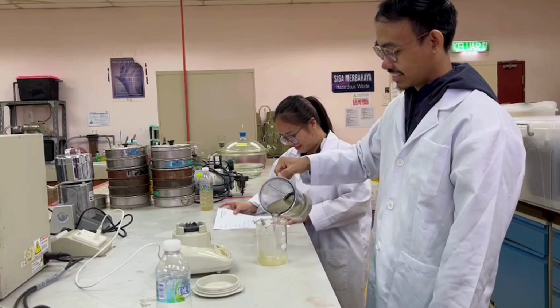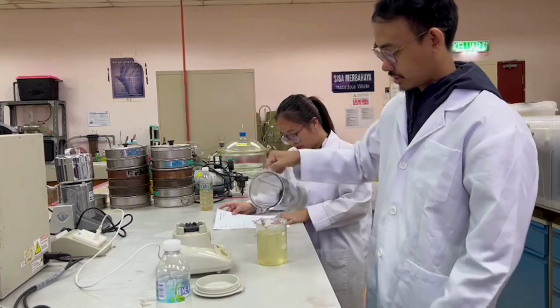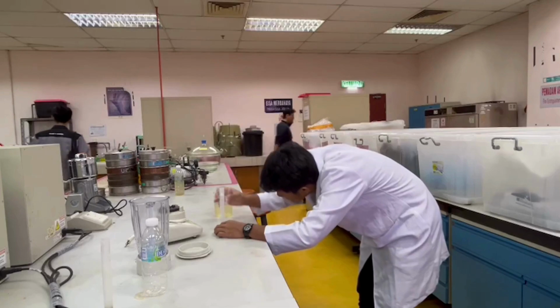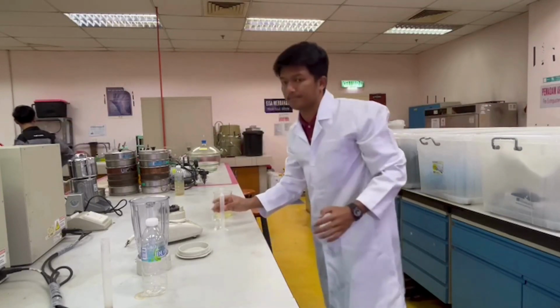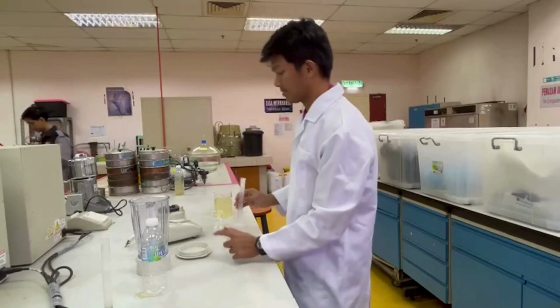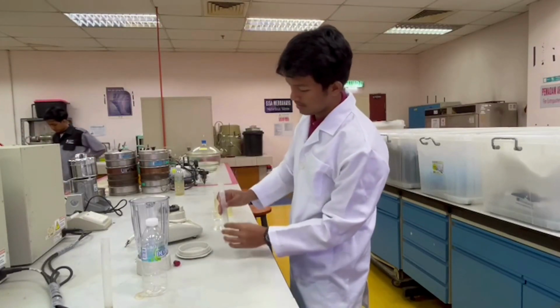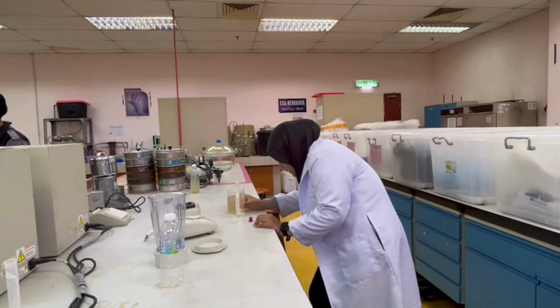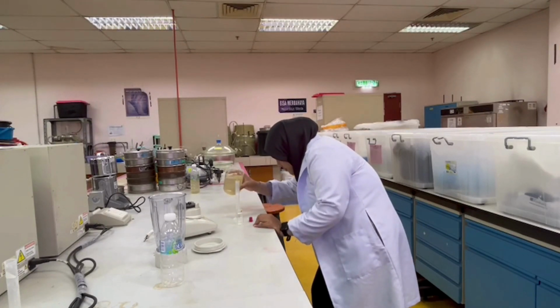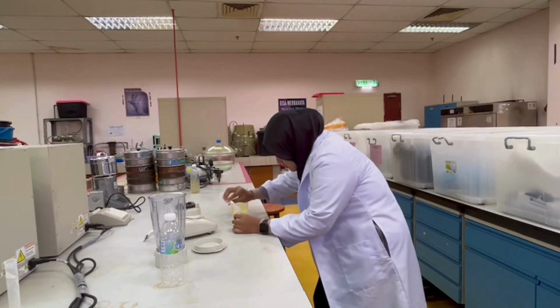After blending, the sample was poured into a clean 600 ml beaker. A 10 ml portion of the blended sample was measured using a measuring cylinder. The 10 ml portion of the blended sample was transferred into a 10 ml square sample cell. Another 10 ml sample cell was filled with 10 ml of tap water to serve as a blank.